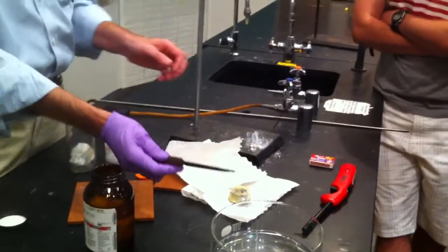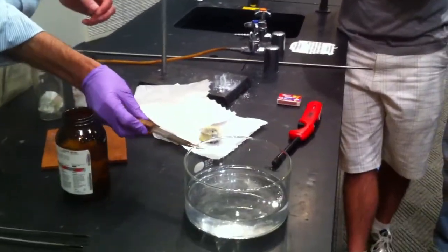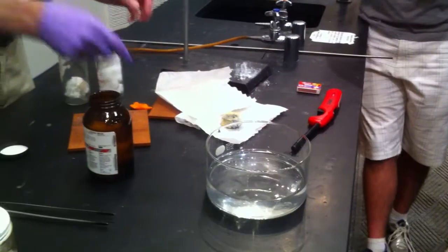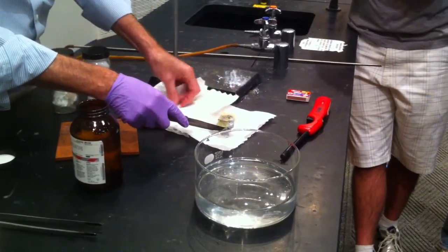And when you put it in, this sometimes sparks a little bit. It's pretty reactive.